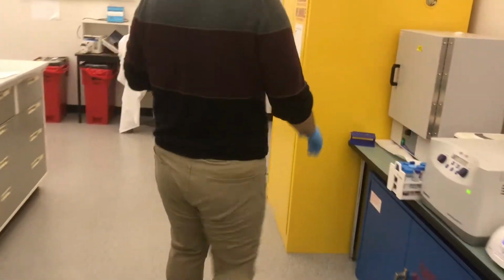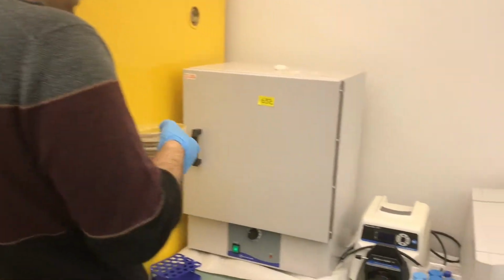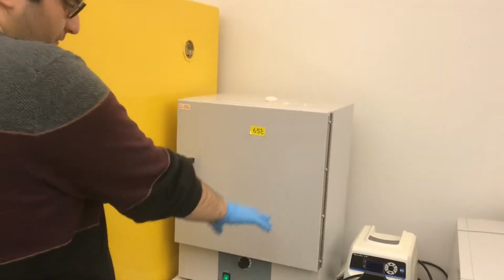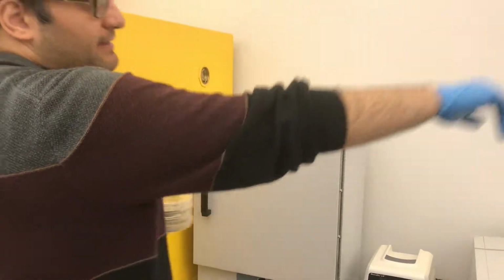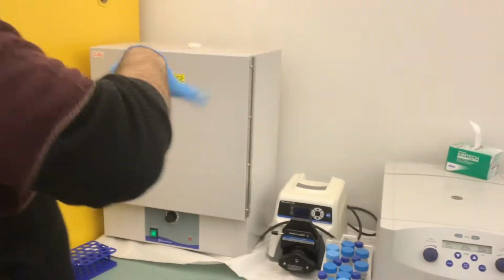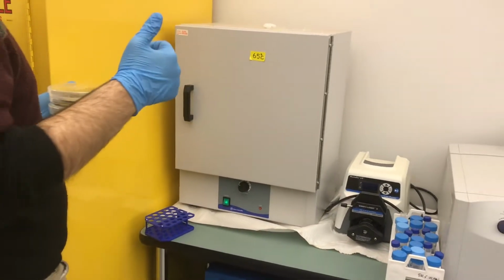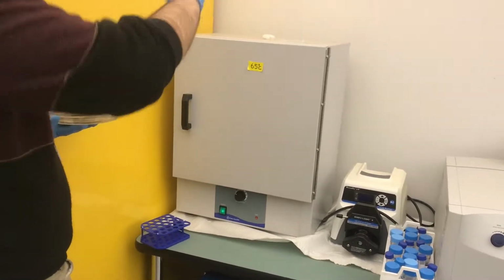And then when you come here, this is the 65 degrees centigrade oven. It is always set at 65 degrees. This one is set at 65 and that one at 85, because we need 2 temperatures for all of our chips. We need 2 temperatures for the master mold to cross-link. For this reason, we use both.